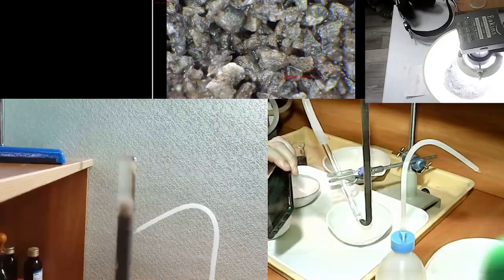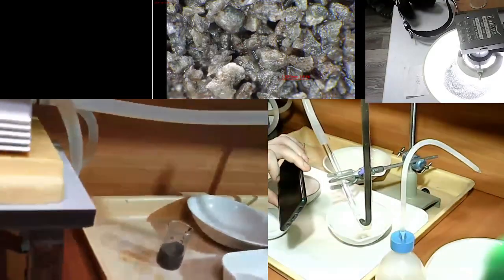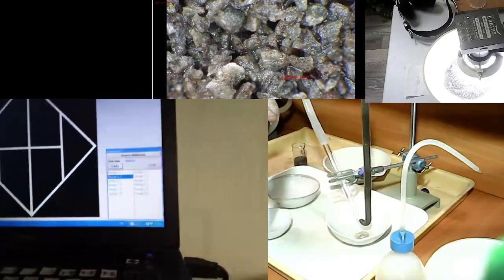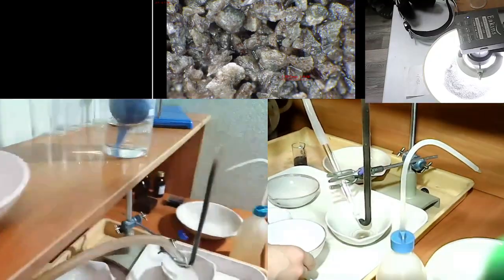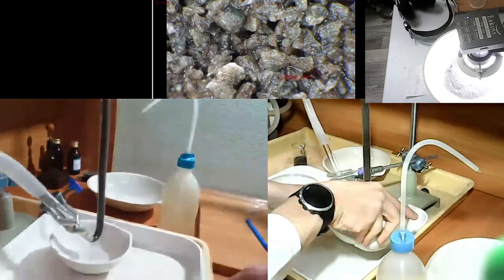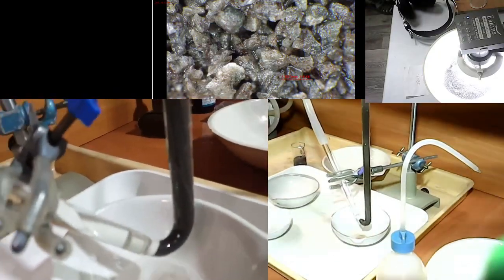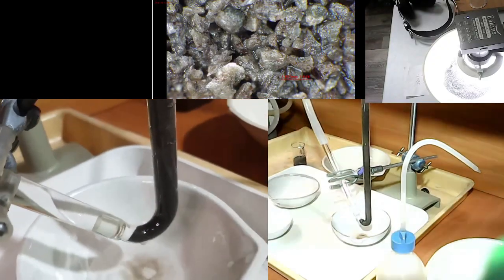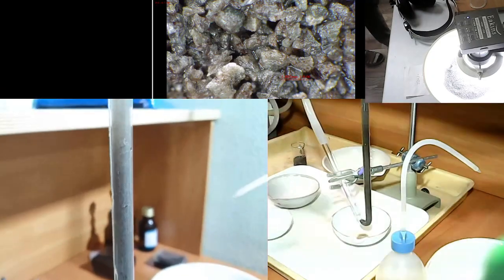So you can see that the water flow is regulated by a needle valve. So we have that process of laminar flow through the use of special needle valve, and then we use specific regimes of hydroseparator, which is an impulse process.